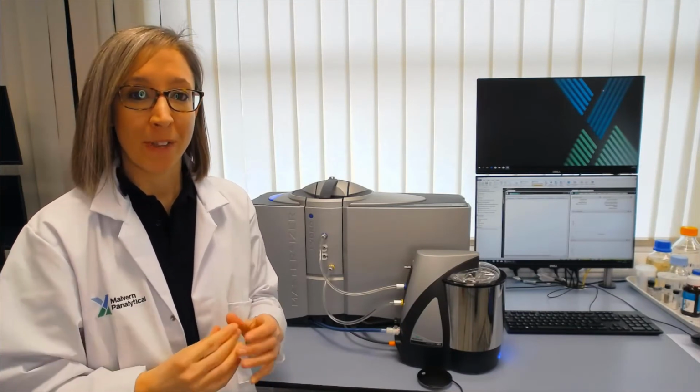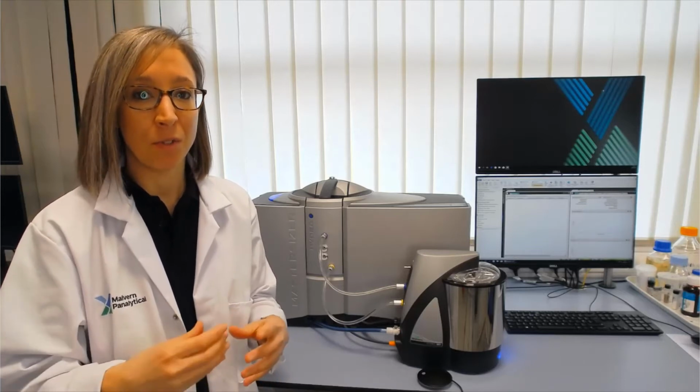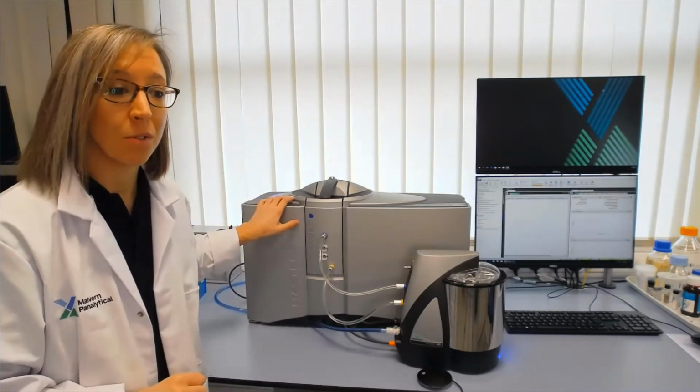First, I'll show you the equipment that we're going to use. So that's the Mastersizer 3000 with a Hydro MV dispersion unit. You'll have heard in our fundamentals section that the Mastersizer 3000 uses laser diffraction to measure particle size, and that's a light scattering based technique. You'll also have seen a schematic of the instrument showing you the optical components that we use to make that measurement. So just to bring those two things together, this is the optical bench.